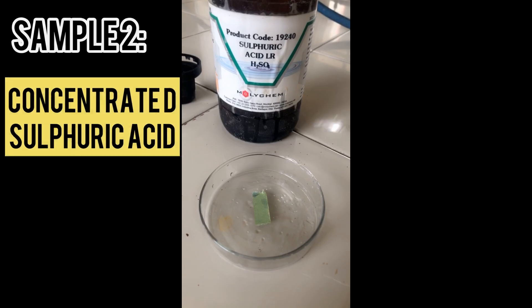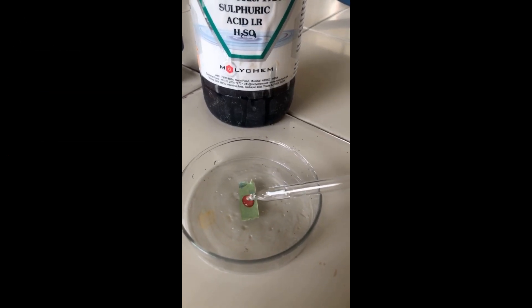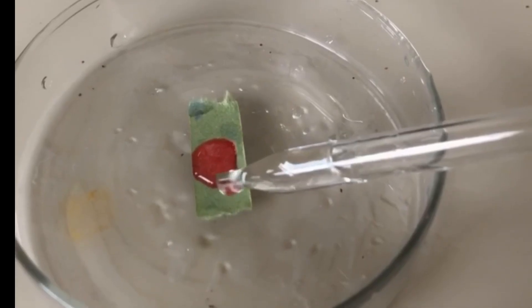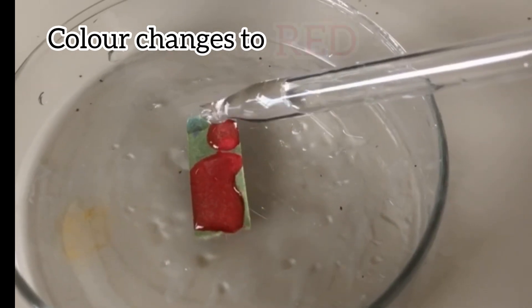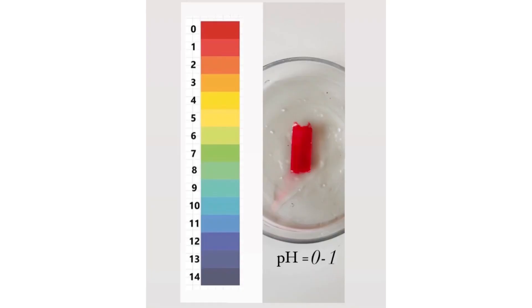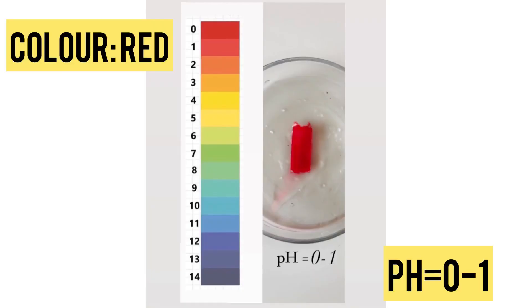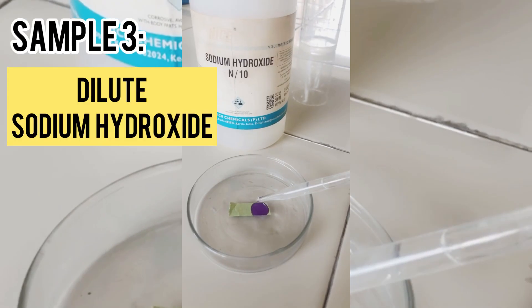Moving forward to our next sample, concentrated sulfuric acid. Note down the color change. It is changing to red. This shows pH is corresponding to 0 to 1.